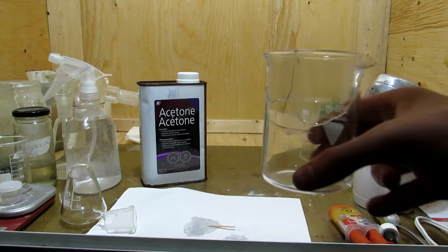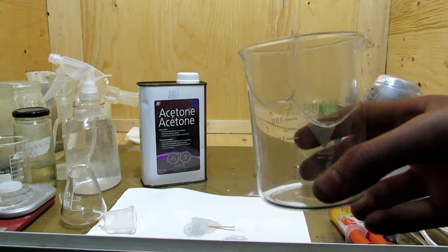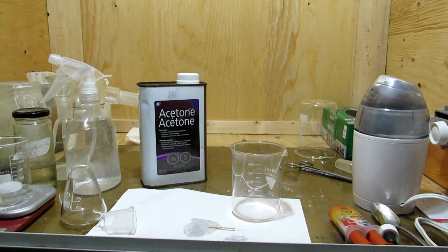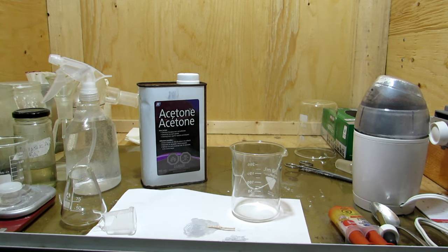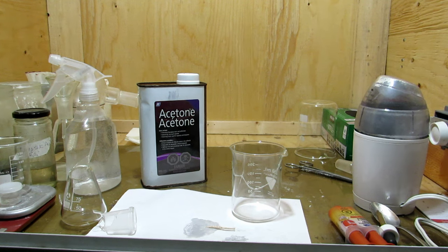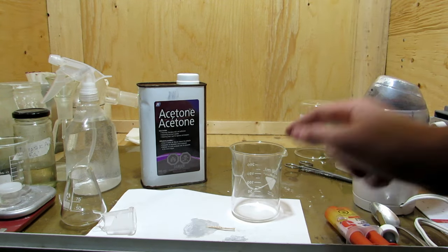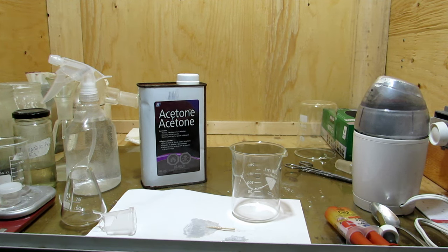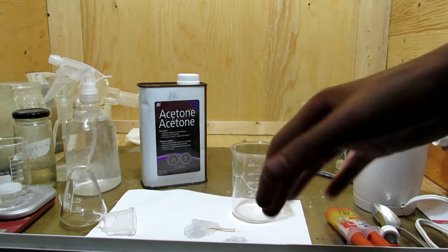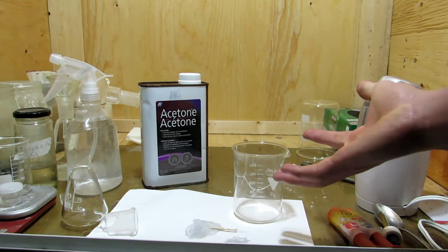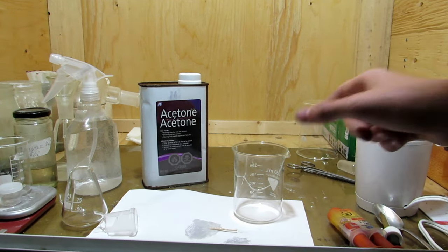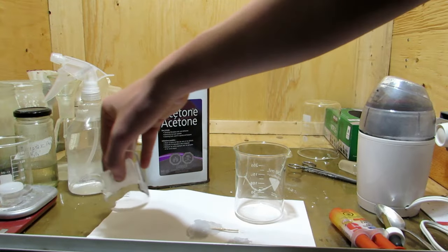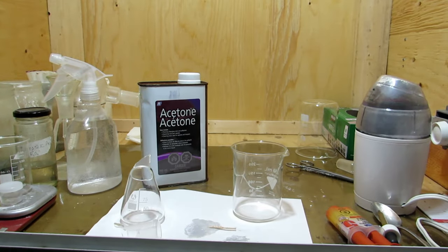Okay, so as you can see, all the pieces have now been set and glued together, but it looks a bit gummy because of all the epoxy which has rubbed everywhere, and that doesn't look too good. So instead what we're going to be doing, well, first we have to let it totally dry, but then we'll take the acetone and remove that. So we'll just take a bit of Kleenex, dab it with some acetone, and then remove all of that excess epoxy. But we have to make sure this is fully cured and hardened before we do so. That's another reason why it's so important to be applying pressure while it sets, so there's not any big gaps. The acetone could get into the cracks and actually dissolve all the epoxy in there. We don't want that happening. We want the epoxy in the cracks to be fine, and only the epoxy on the surface to be removed. So I'm going to finish letting this fully cure and harden, and move on to this one. Then I'll meet you guys back in an hour, and then we can remove it with the acetone.